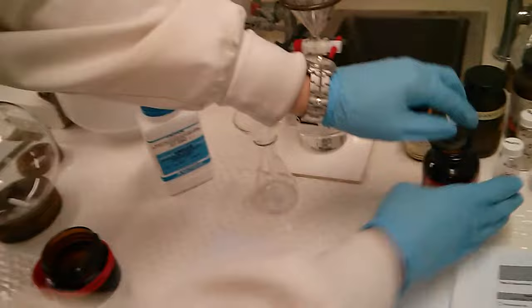So we'll just have a go of pouring it out. And it's a little bit stuck. It looks pretty damn clean. It's a little bit green, but it's better than anything else I've seen.